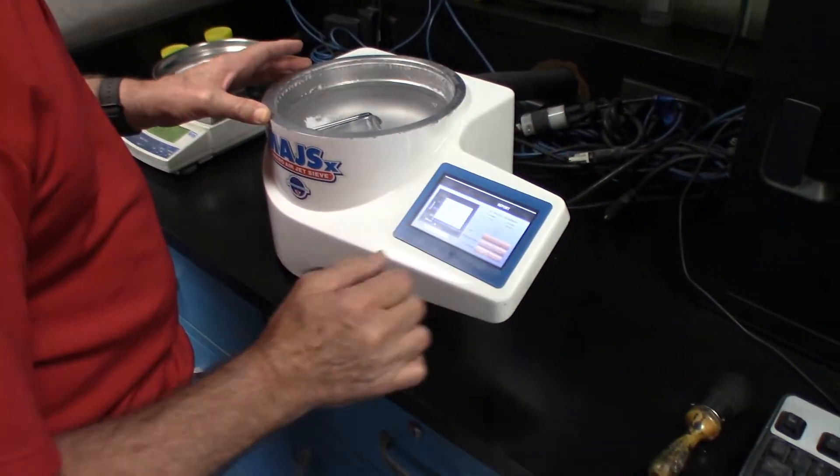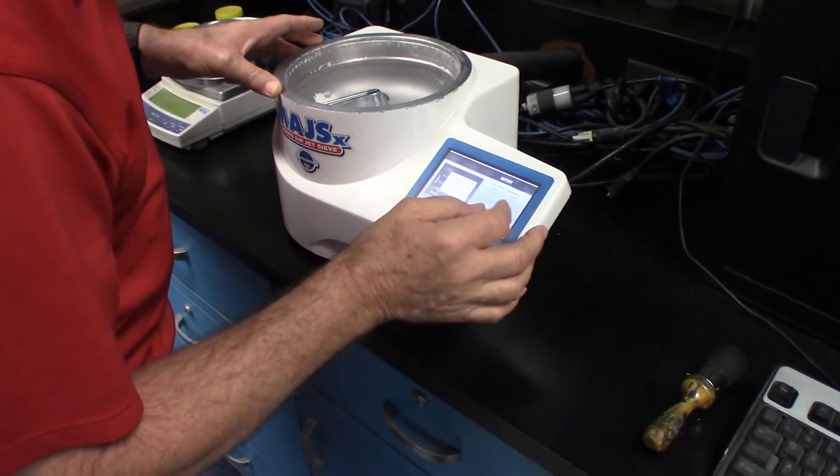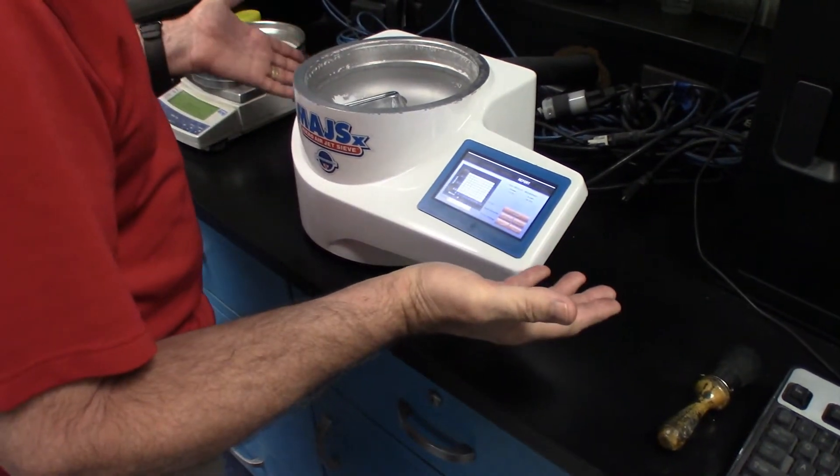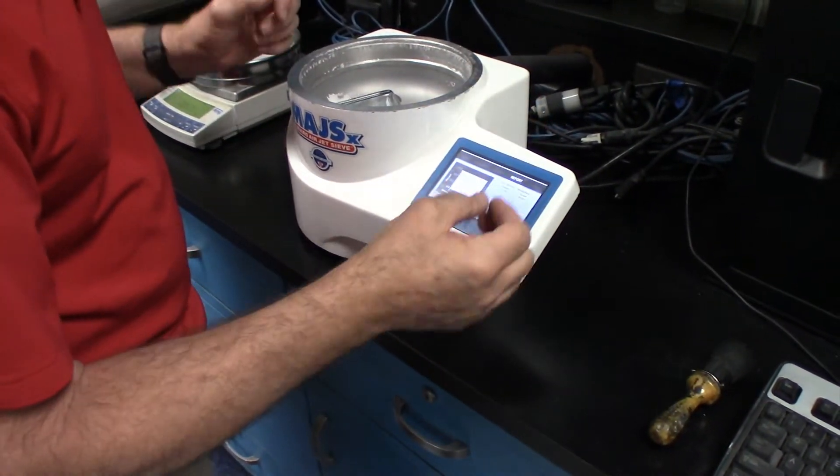Test is complete, and the analysis is indicating it's approximately 95% less than 75 micron.